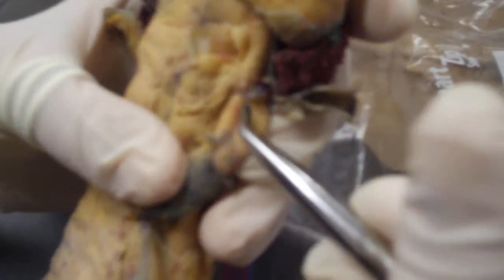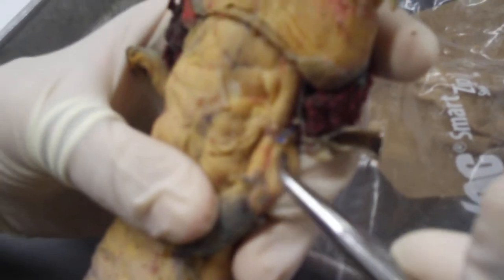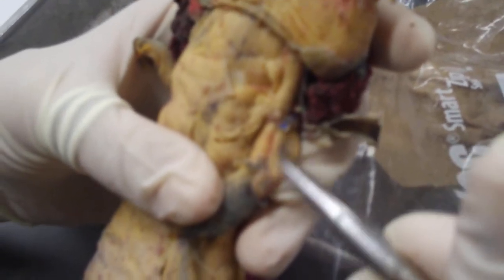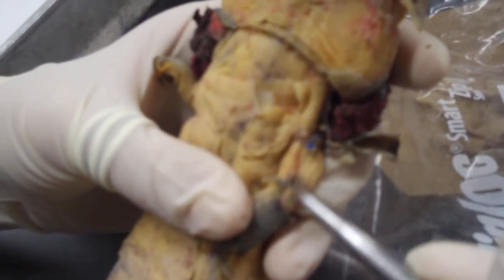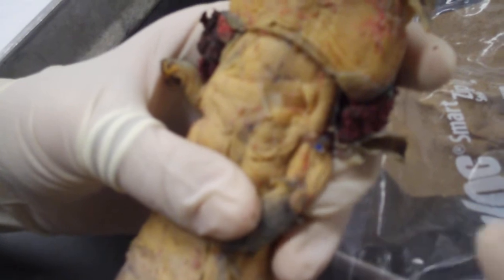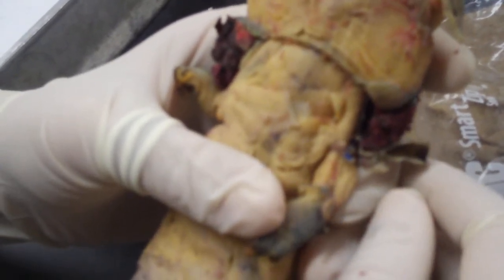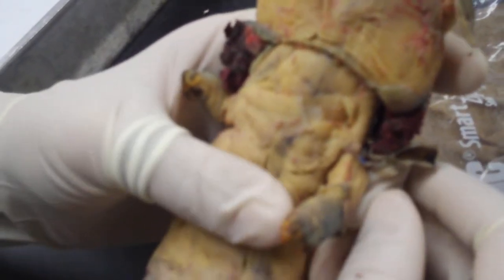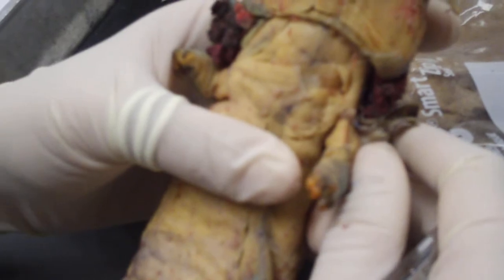And then right to the outside here is the humeroantibrachialis. I think that's it that you need to know for the muscles. Thank you.